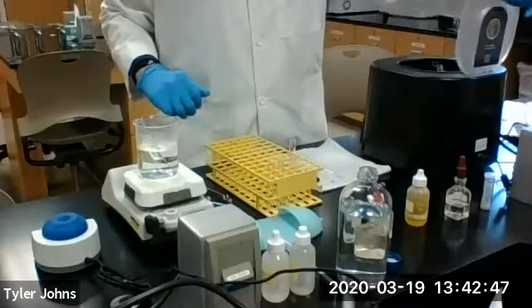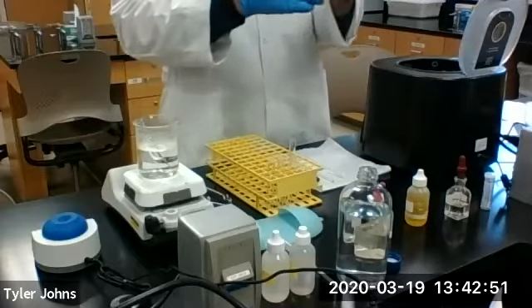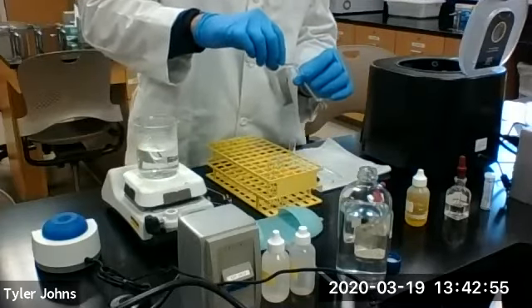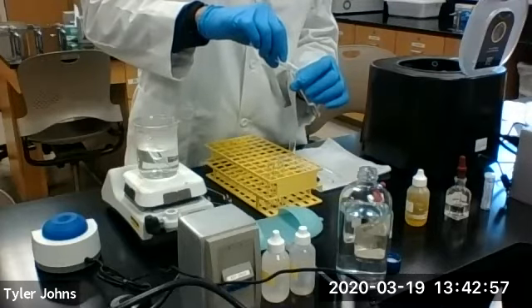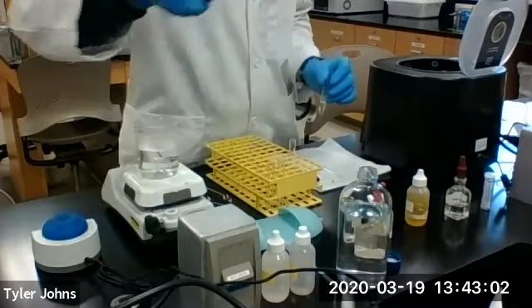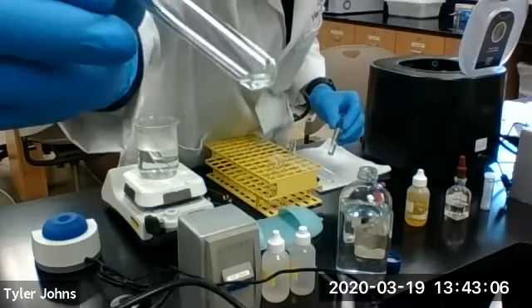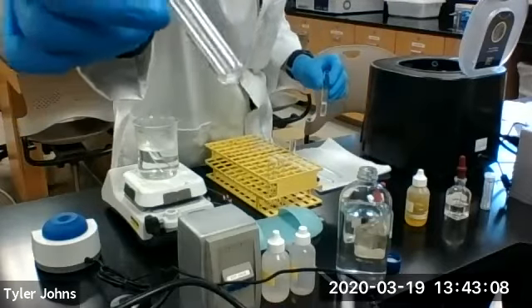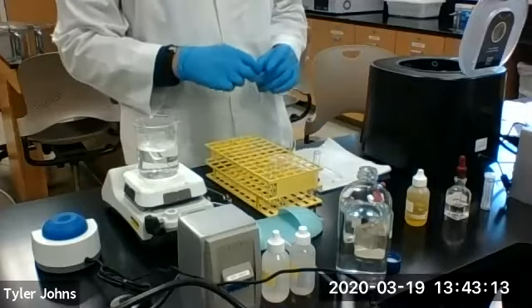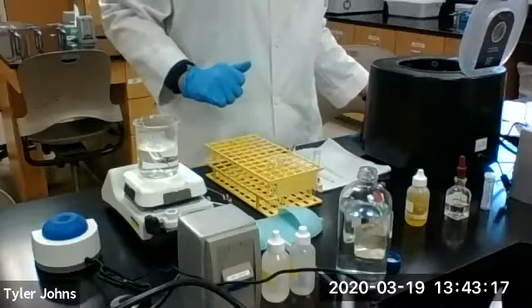So our centrifuge is stopped again. We're again going to discard the wash. As you can see, we have our precipitate remaining, which is residue 2, or R2. At this point, we're going to set it aside and analyze later for silver ion.